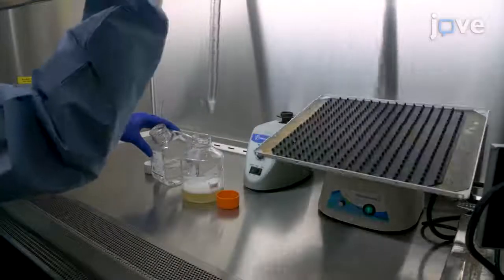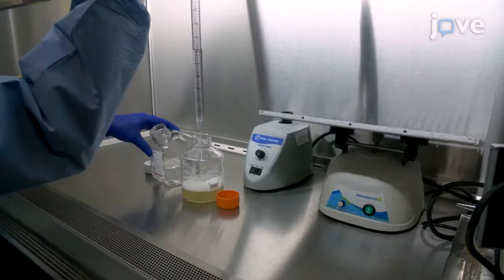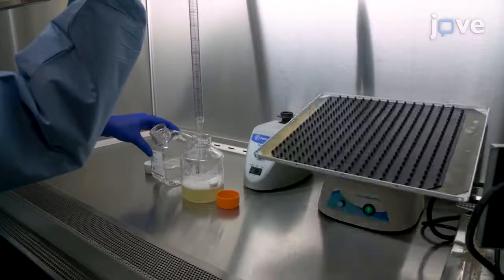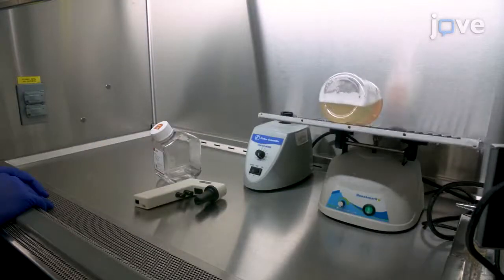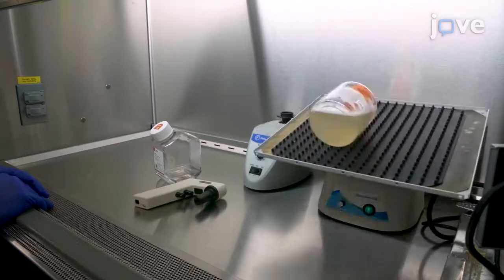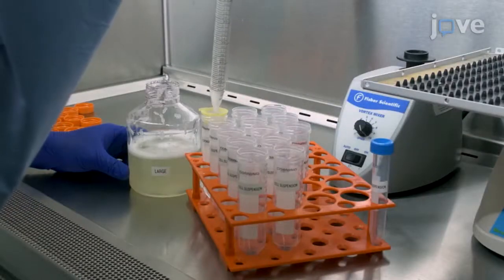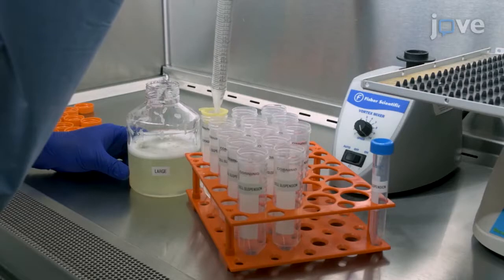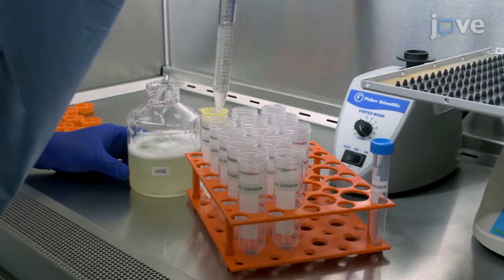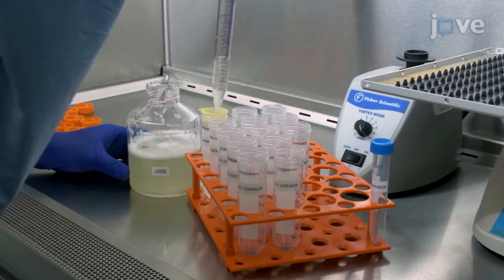Dilute the sample with 4 times Hanks balanced salt solution, or HBSS, to neutralize the NAC and DTT. After quick vortexing, rock the sample at room temperature for 5 minutes. Filter the cell suspension through a 100 micrometer nylon mesh cell strainer into one or more 50 milliliter conical centrifuge tubes to create a single cell suspension.